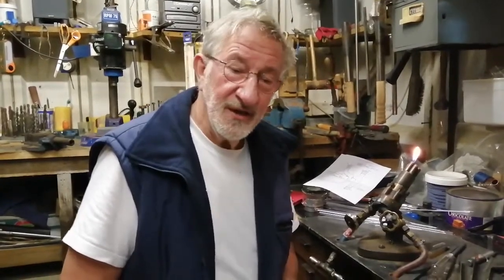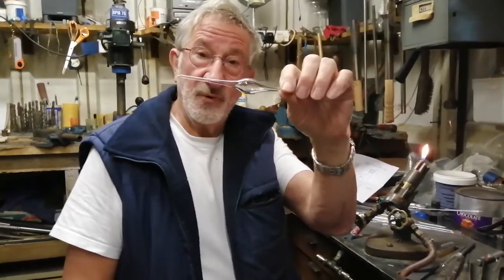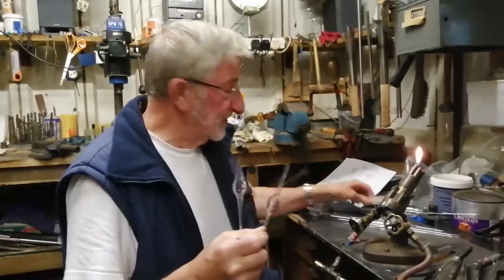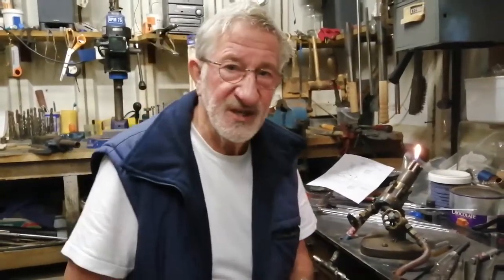I'm going to demonstrate a little bit of glassblowing, and today I've got Carolyn, who's a friend in the village at Bere Alston, the centre of the universe, and we're going to do a little bit of demonstration to show you the sort of thing that we'll do when we are doing the Treehouse Festival in 2021. Part of the training exercise involves the beginner, who will be Caroline, making a nice glass bulb from blowing from this. I prepared these points from some tubing that looks like this. And what I've done is I've melted the glass down, make some points. And first I want to just demonstrate that pulling stage.